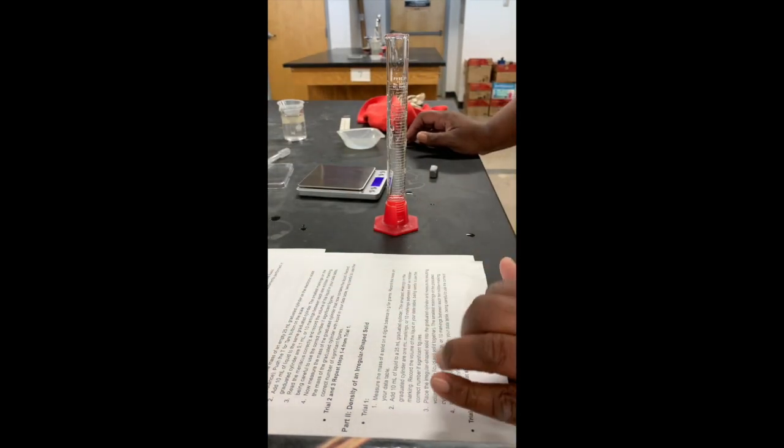Okay, guys, so for trials 2 and 3, you can just copy the mass of the solid across. And I believe we got 43.79 grams. So you're going to put that for trial 2, and you're going to put that for trial 3. Same thing for your volume of water. We're always going to use 10 milliliters of water. And what we're looking to do is test, when we put it in, does anything change, or are we getting the same precise number? So that's the part I'm going to do and show you for trials 2 and 3.